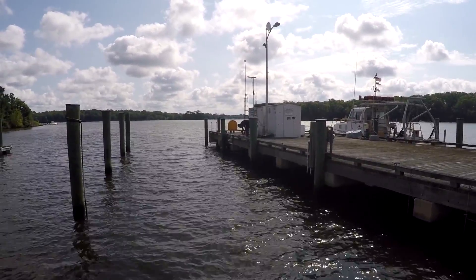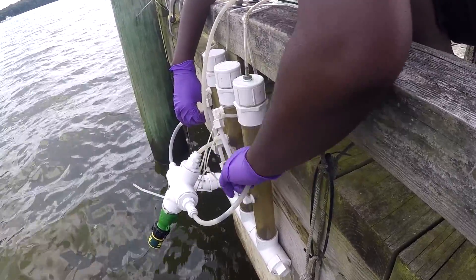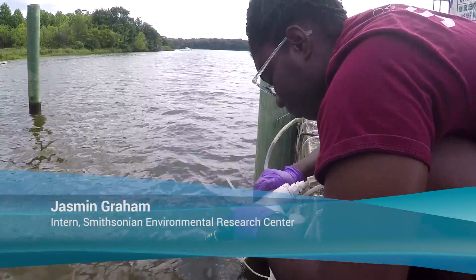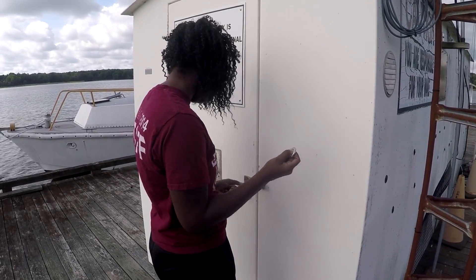We're really interested in getting more and more measurements in coastal systems, and so using the CO2 Scout, this instrument that we've developed, you actually bring air and water into equilibrium such that the air reflects the concentration of gas in water. Once you equilibrate the air with the water, you can then actually measure the concentration of the air and be able to say what the concentration is in the water.